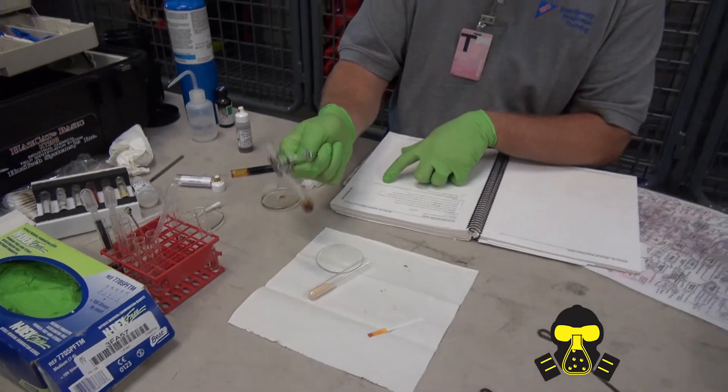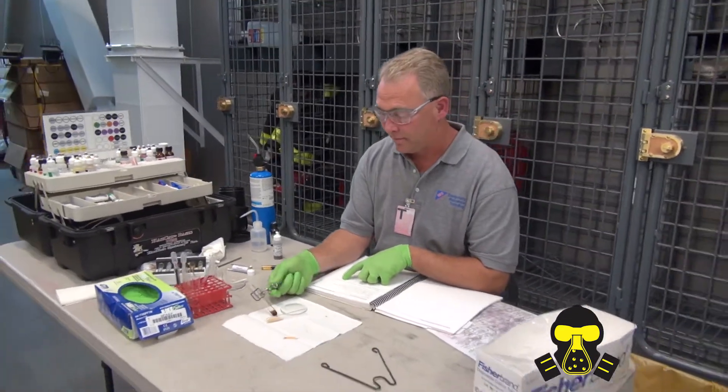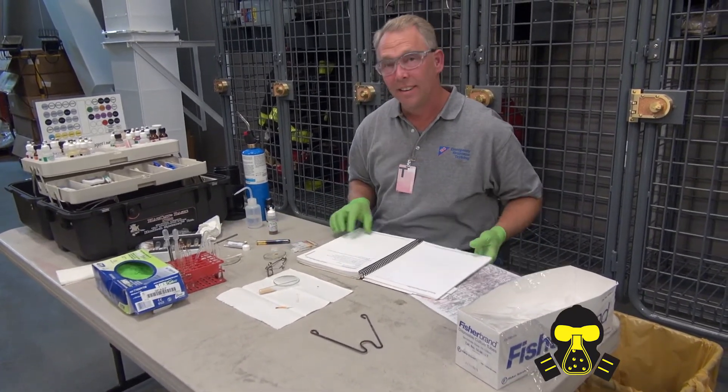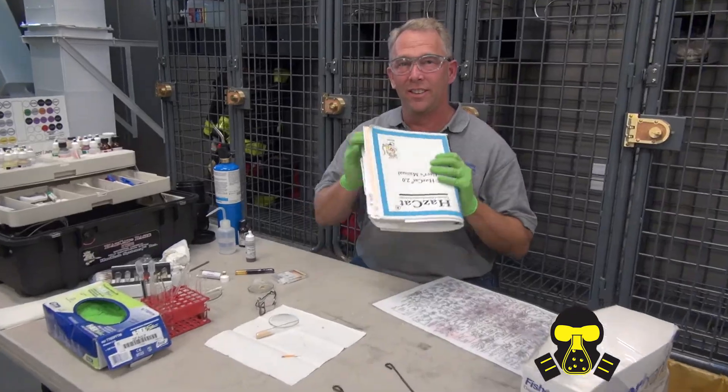Poly alcohol — he's got it. I tried to fake him out with a simple one. I gave him some packet sugar — raw table sugar. It is raw sugar. That's it.